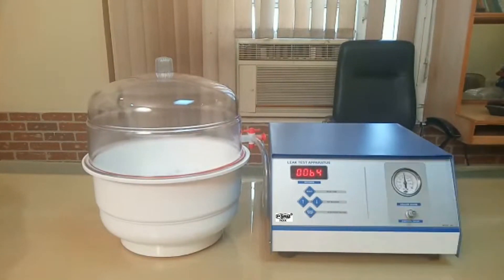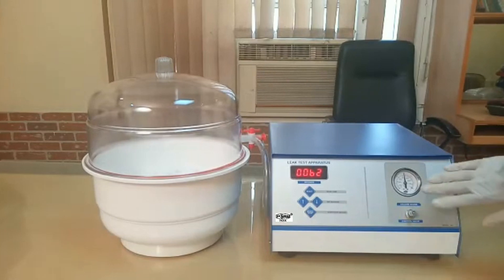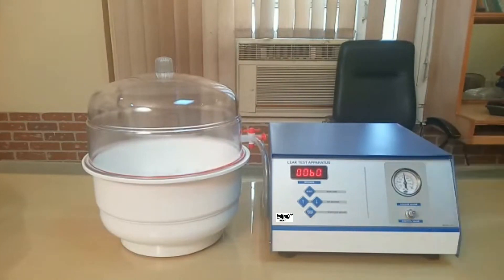The pressure will remain intact throughout the hold period. There may be a slight change for the upper and lower limit, but in most cases it will remain stable.